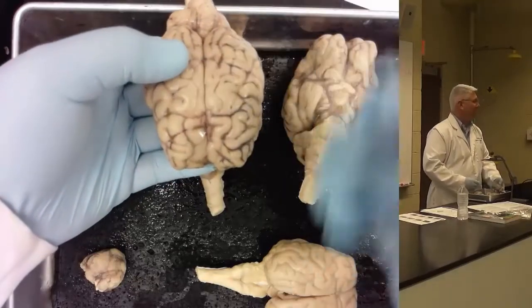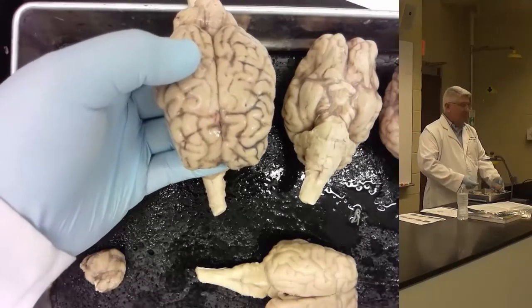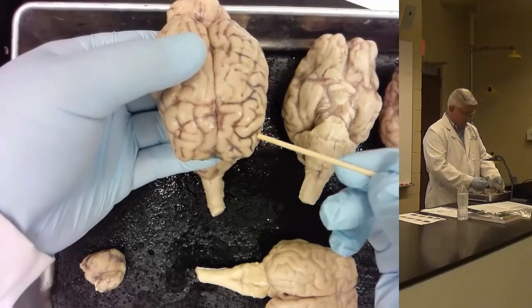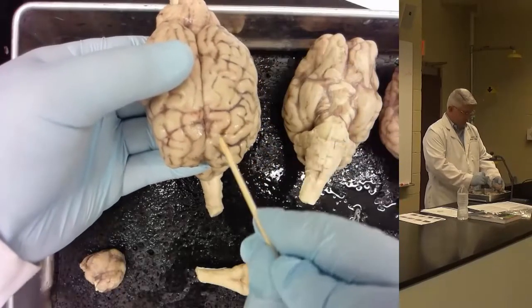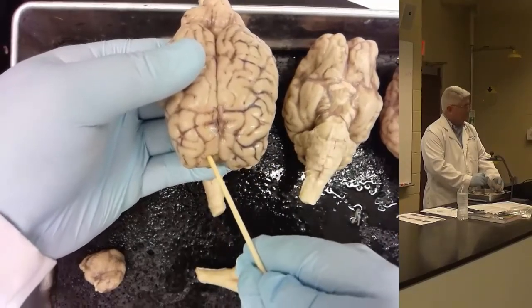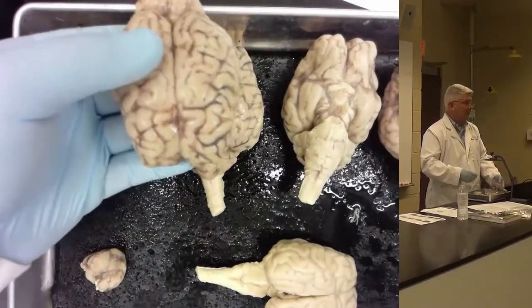Yes, Becca? Does the gyrus go all the way down with it too? Yeah, so you have to use your imagination, and this is why no 2 brains are alike. The superior frontal sulcus kind of stops here on this side, kind of makes a curve this way, but really you think about it as an imaginary line of 1/3, 1/3, 1/3. Over here, it comes all the way down, and you have a nicer superior frontal gyrus. So even on this brain, the left and the right side don't look the same. That's why I'm saying you have to use your landmarks. You have to go through that process.